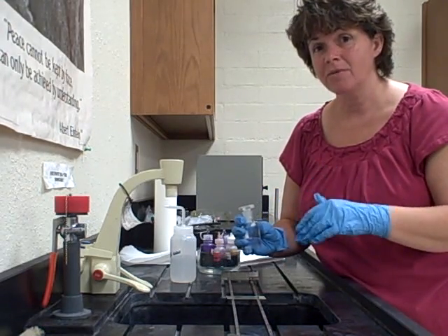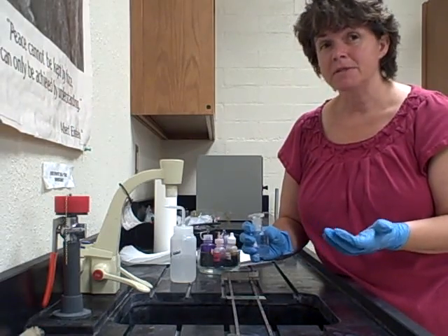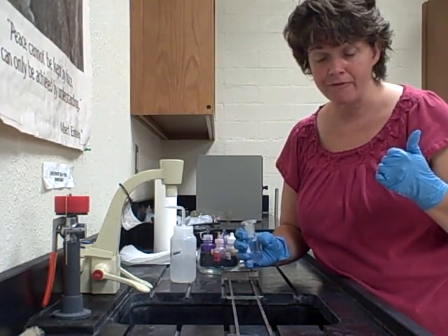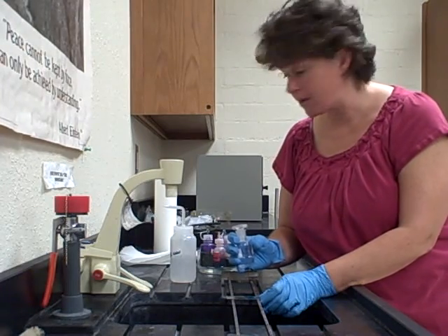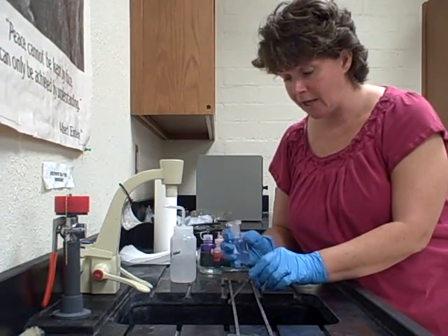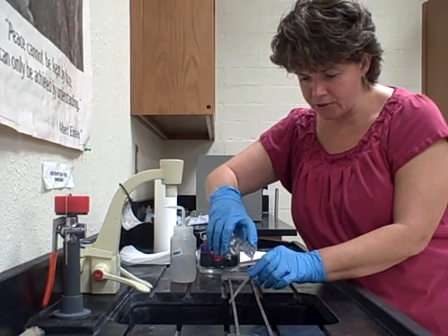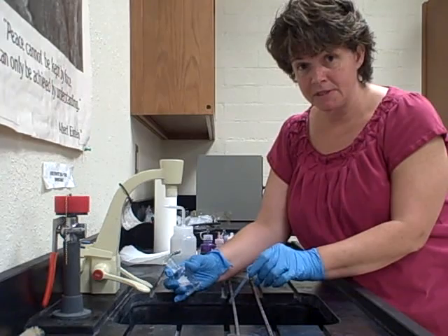It's not really a time period — you don't let it sit. You actually run it off. If you've ever colored your hair, this is kind of the same procedure: after coloring your hair, you rinse until you don't see any color coming off. That's the same thing here. On page 36, step E, hold the slide at a 45-degree angle and let the alcohol drip on until you do not see any color coming off the bottom of the slide.